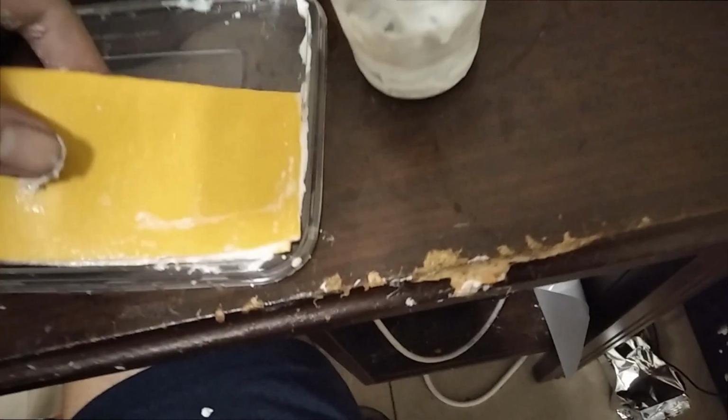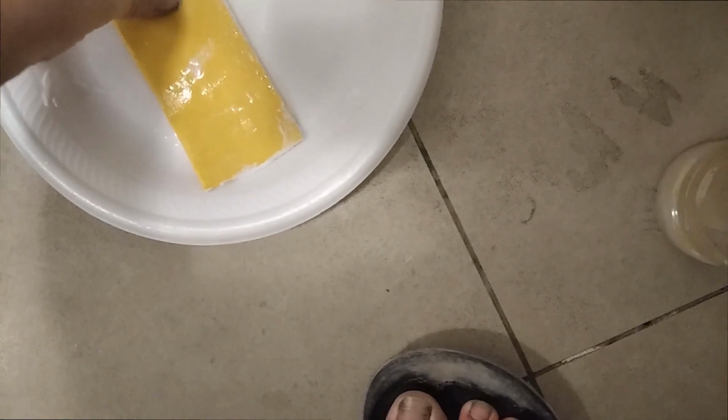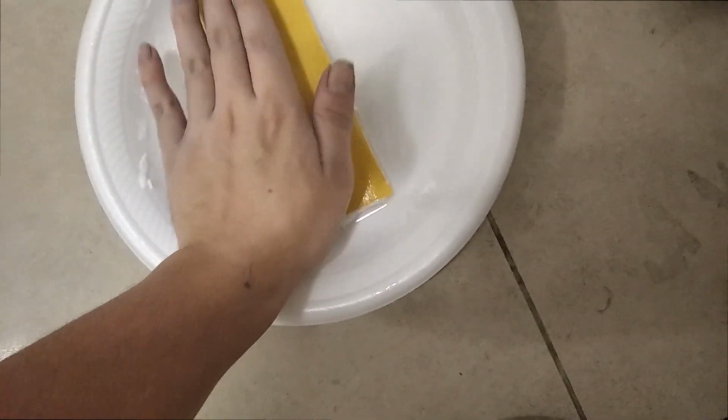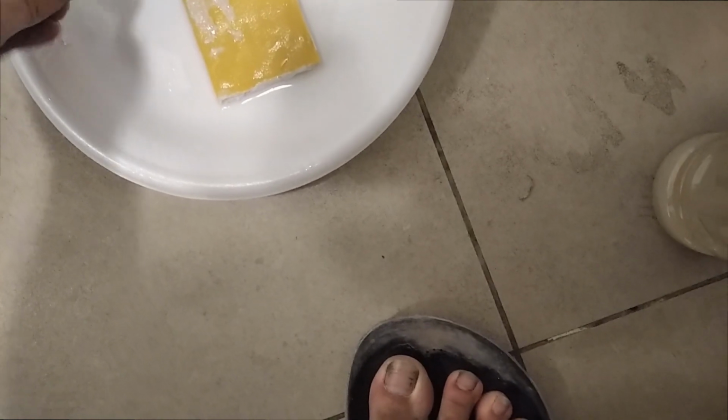After this, you then take your solution. This is sodium borate. Now, sodium borate, you just stick your burrito down here, and you just keep rolling. Once you roll, the solution will absorb. And when the solution absorbs, the membrane hardens. And when the membrane hardens, the performance will be guaranteed.